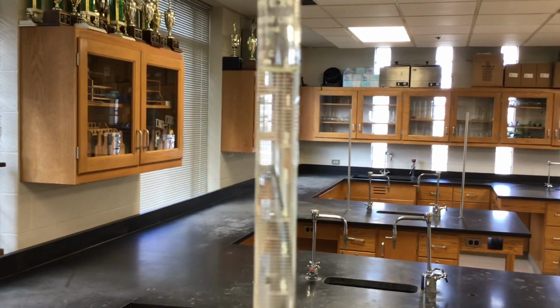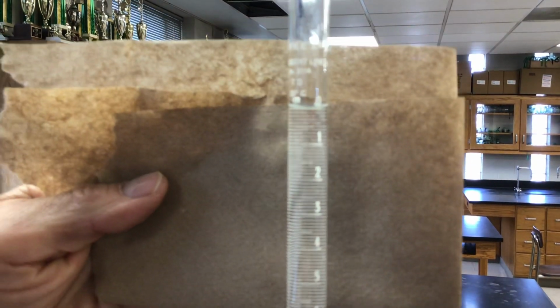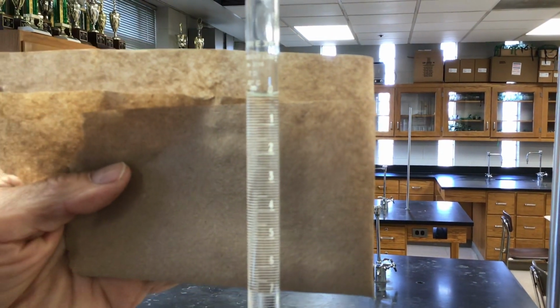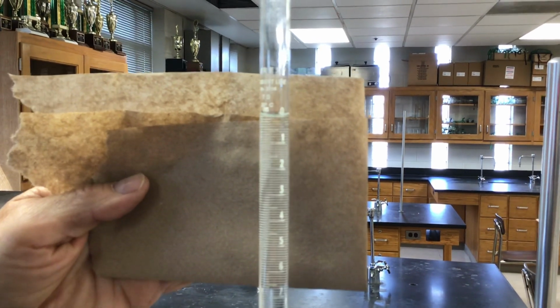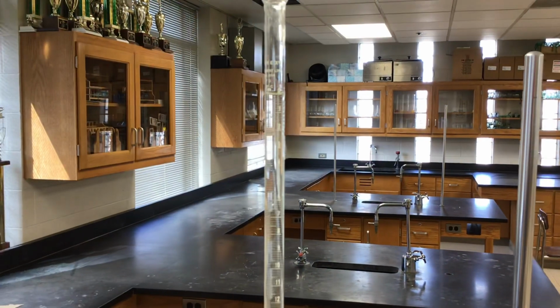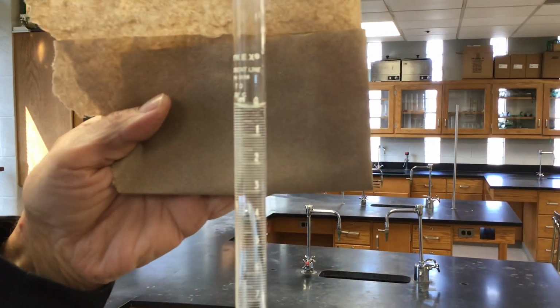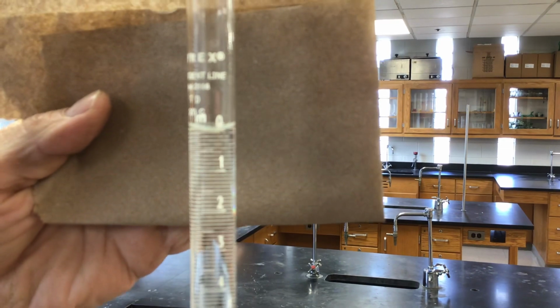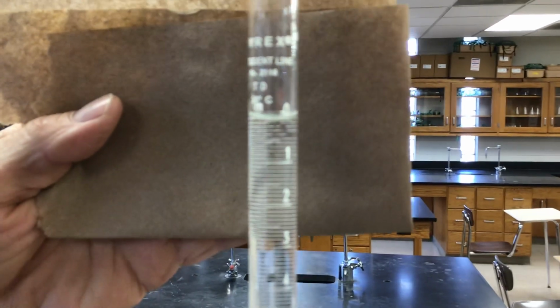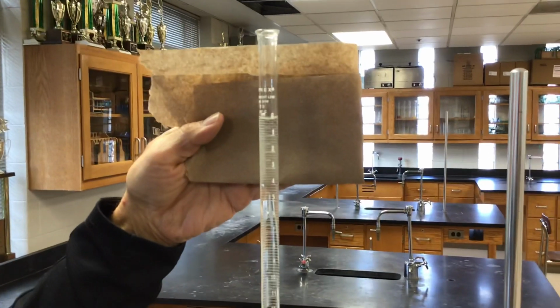Do we need the background to see that? I don't know how well you can see that. It's marked off in 1/10 of a milliliter, which means we can estimate to the hundredths place. Are we having trouble focusing now? Just a few minutes ago, it was focusing fine. I can't get a nice sharp image. Is it the background somehow? We can't really see the lines. We're going to have to figure this out, because if you can't see the bottom of the meniscus and where the line is, that's bad. Maybe if I stand back here and zoom in.